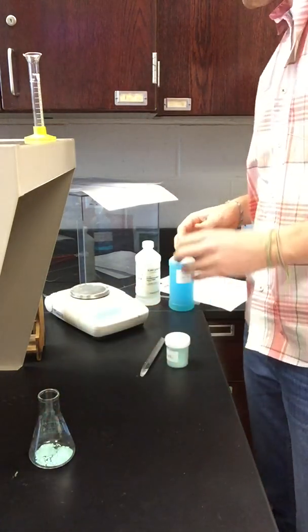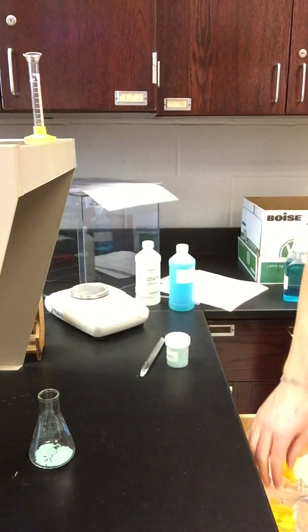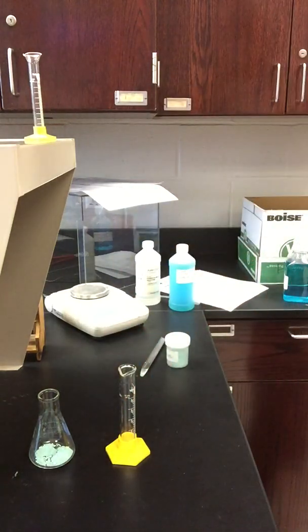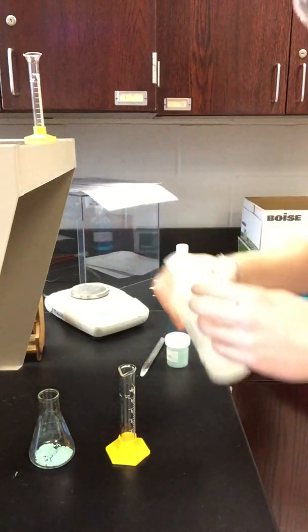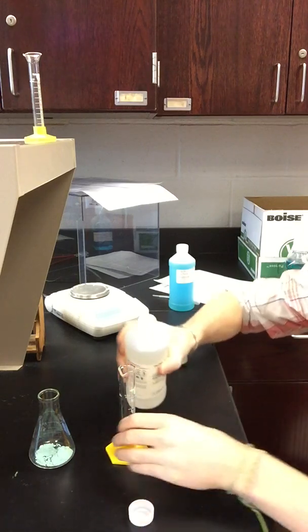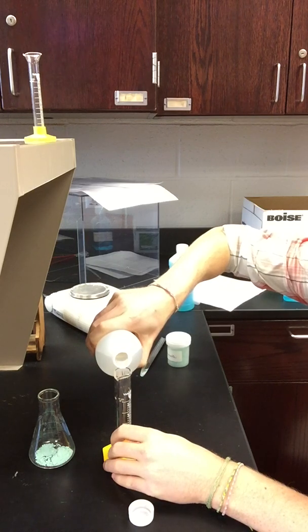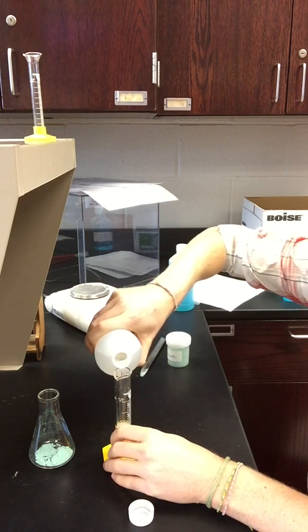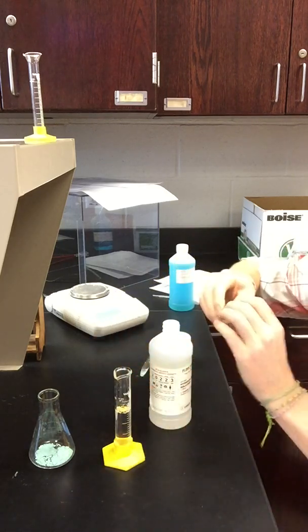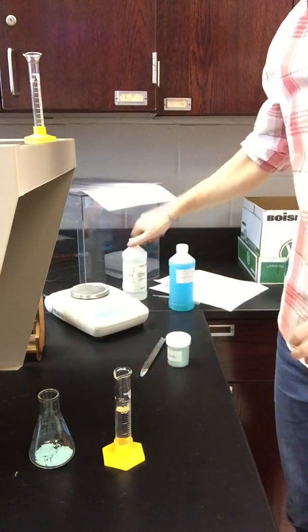Now the next thing we're going to do is grab ourselves a graduated cylinder, and I'm going to grab 20 milliliters of hydrochloric acid. So I'm going to measure in 20 milliliters of hydrochloric acid into my graduated cylinder. This is 2 molar hydrochloric acid. Now, instead of measuring the HCl by volume, we're going to measure it by mass. So I'll go for about 20 milliliters. There we go, meniscus up to 20. And I'm going to put that HCl graduated cylinder onto my balance.